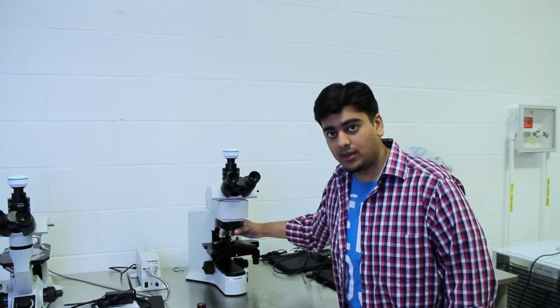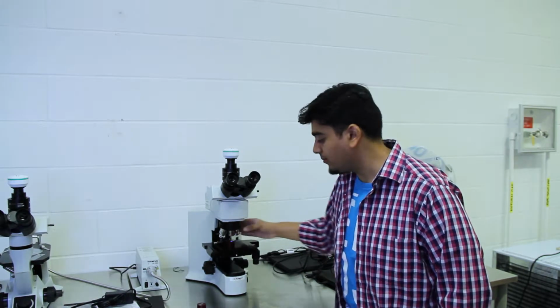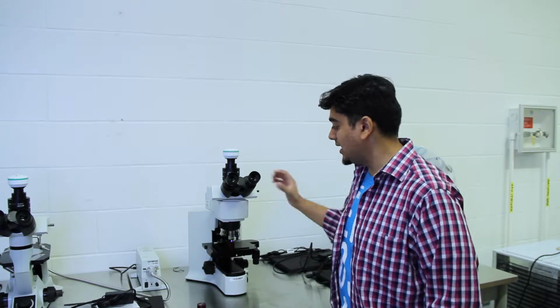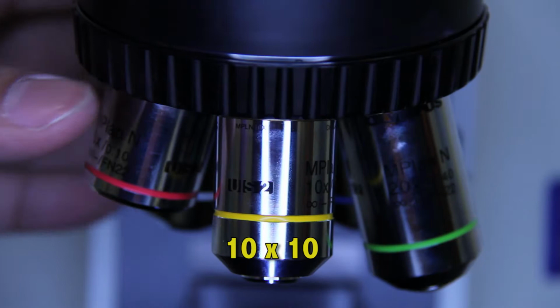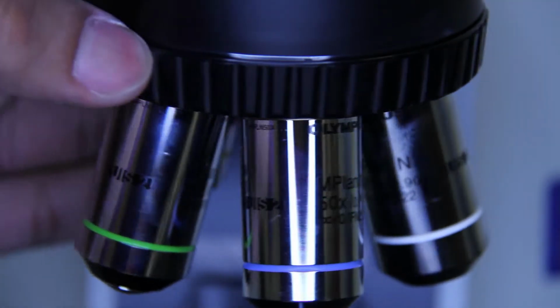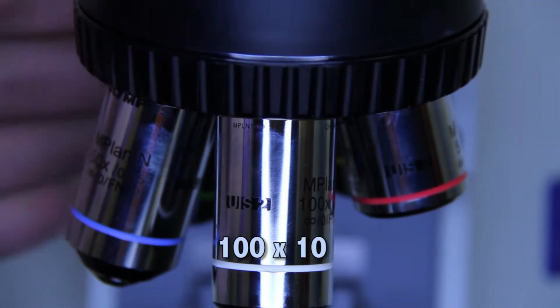So once you've set your sample onto the bed of the microscope, now you can change the magnification at which you're going to view your sample. So on this knob, we have many different magnifications, each with their own magnification written on them. You have 5 times magnification, you have 10, you have 20, and so on. But the thing to keep in mind is that inside the microscope, there's already a times 10 magnification built in. So any value that's written on the magnification lenses is actually multiplied by 10. So keep that in mind when you're doing your labs.